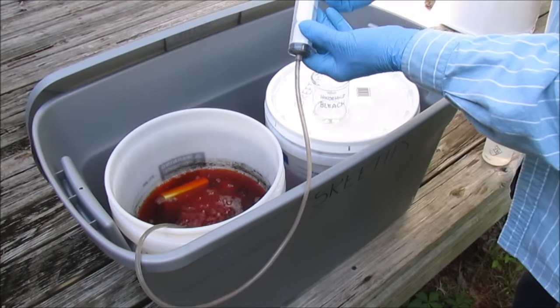I want to do a little review here. This beaker has got the solids precipitated with zinc from the first bucket — I added some hot tap water trying to get that to settle out but I've got a colloidal suspension in there, though most of it has settled to the bottom. This beaker has the contents from the second bucket that we filtered from the leaching. These were less concentrated solutions, so they're going to tend to stay suspended. And this is the most recent beaker — I just added zinc after filtering out the fine particulate. I've got all four beakers now with my precious metals in them. I'm going to siphon these off and try to get all the metals consolidated into this main beaker.